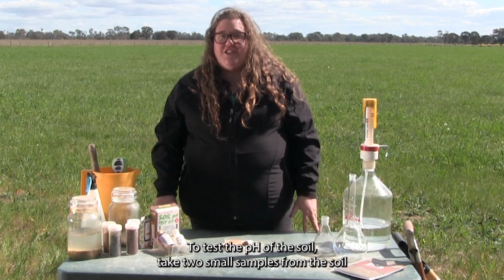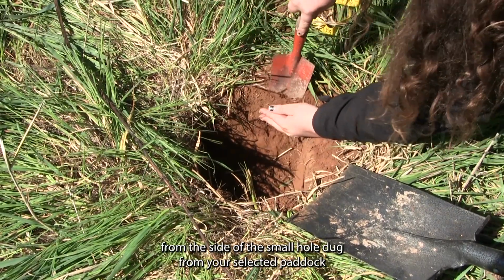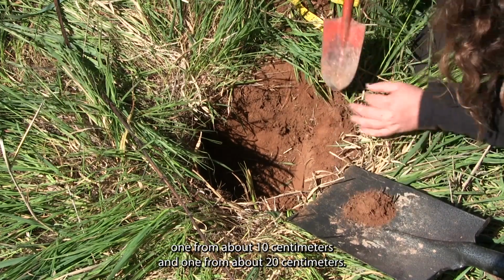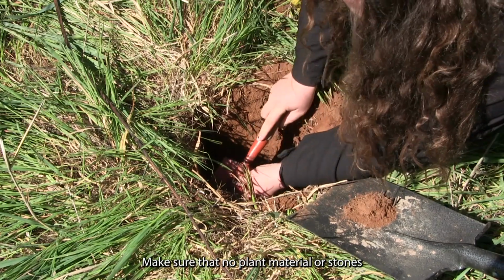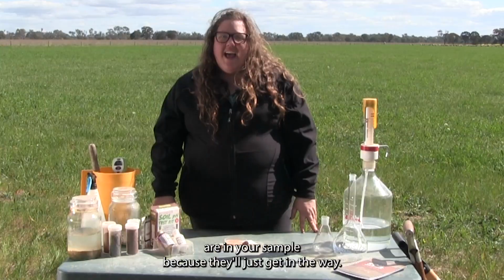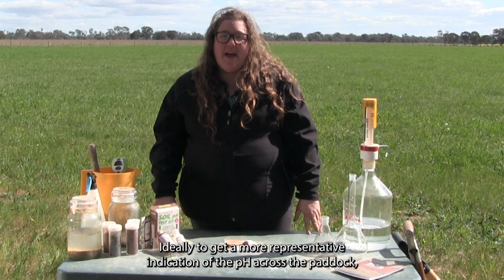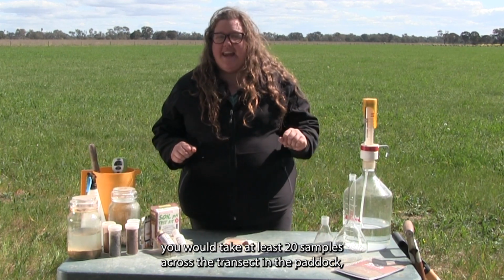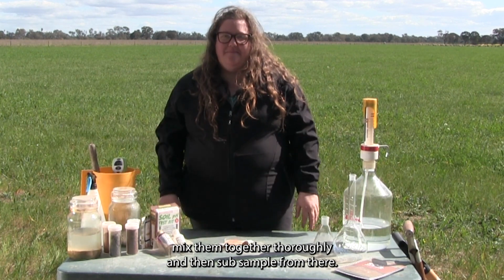To test the pH of the soil, take 2 small samples from the soil from the side of the small hole dug from your selected paddock. One from about 10 centimetres and one from about 20 centimetres. Make sure that no plant material or stones are in your sample, because they'll just get in the way. Ideally, to get a more representative indication of the pH across the paddock, you would take at least 20 samples across the transect in the paddock. Mix them together thoroughly and then subsample from there.